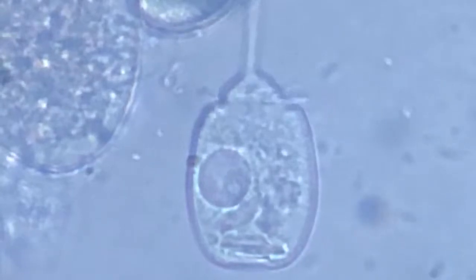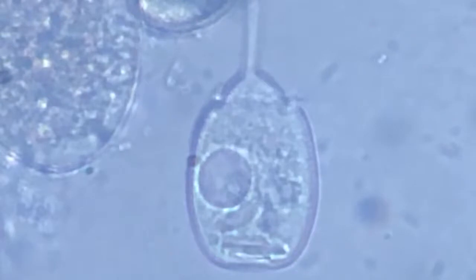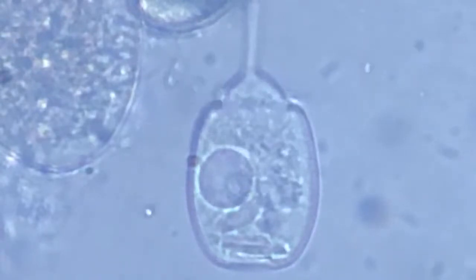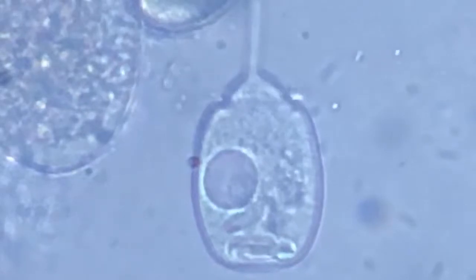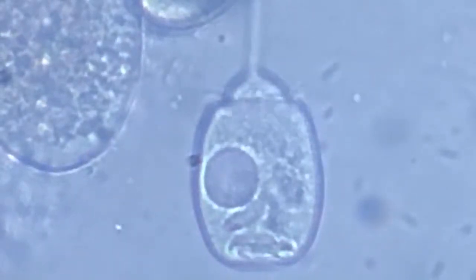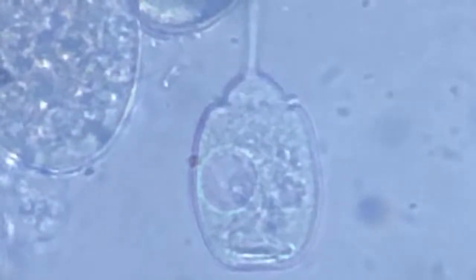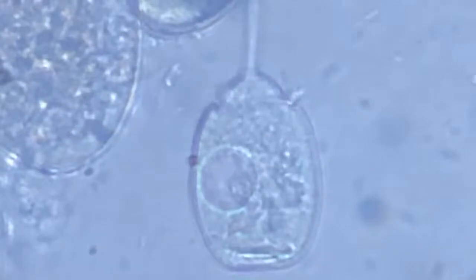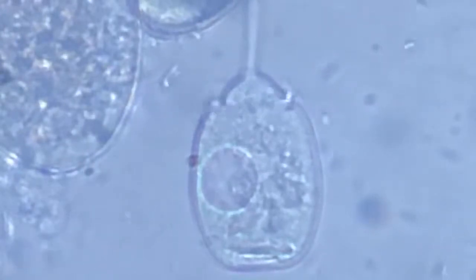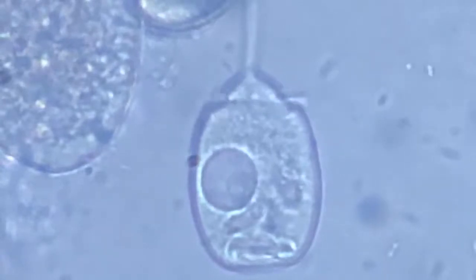All right, I'll just leave it at this focus and see if something happens for us to observe. The vacuole is still pretty big. Must empty now because its sides are in complete conjunction with the cell side.